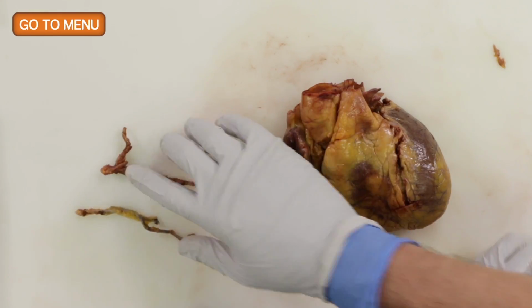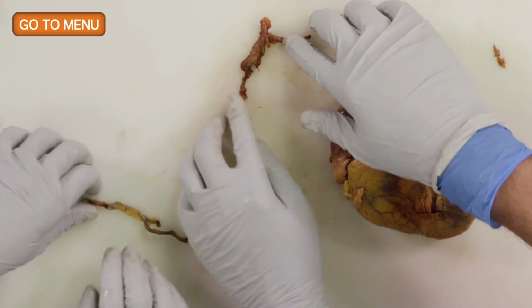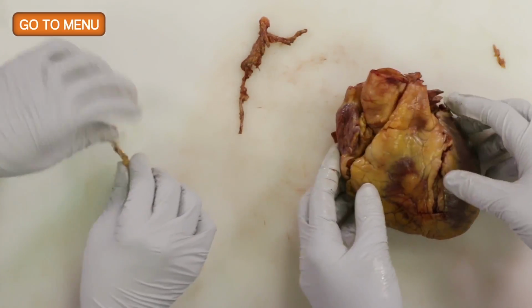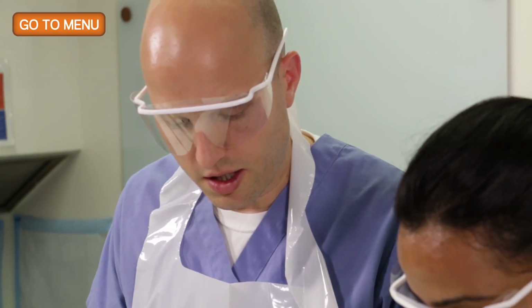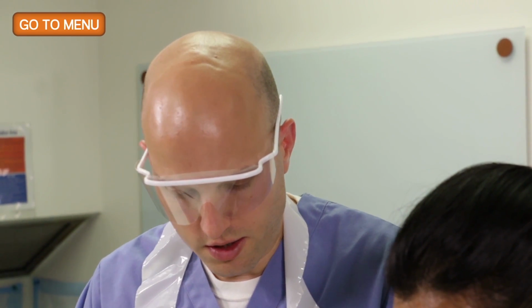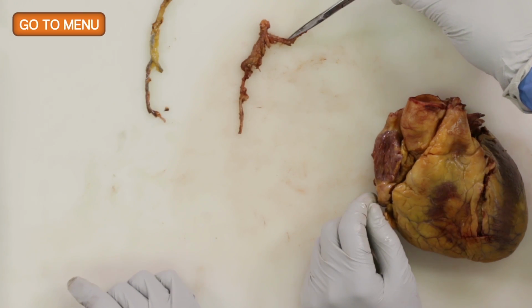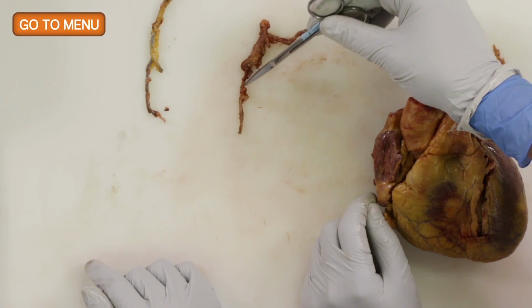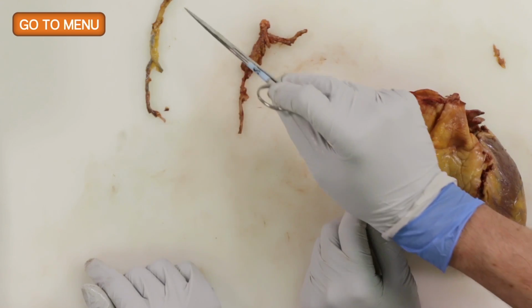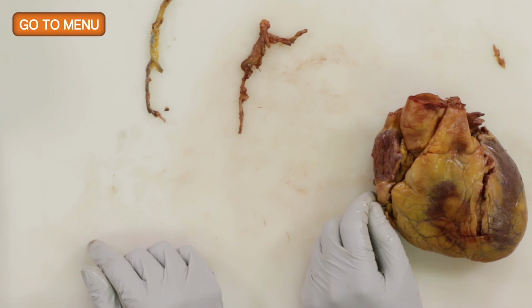These vessels, I think, are not as calcified, and so we can cut them immediately and see how much stenosis there is. So again, and as you mentioned, the left main coronary is here. It branches into the circumflex and the left anterior descending. And then this is the right coronary that comes straight off. So you want to serially section them and see if there are any thrombi there.